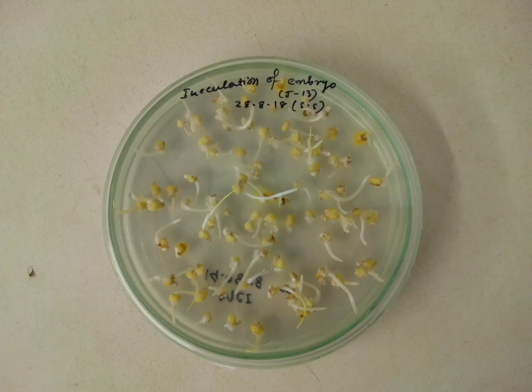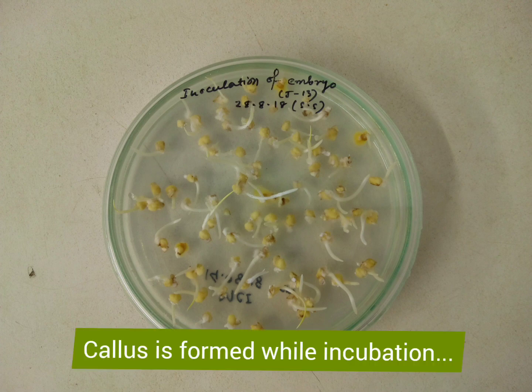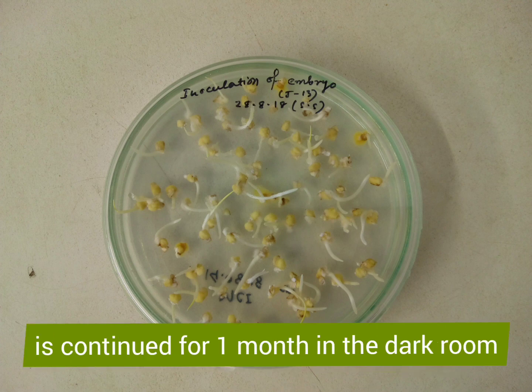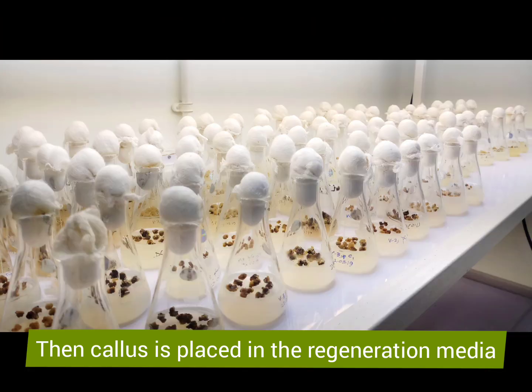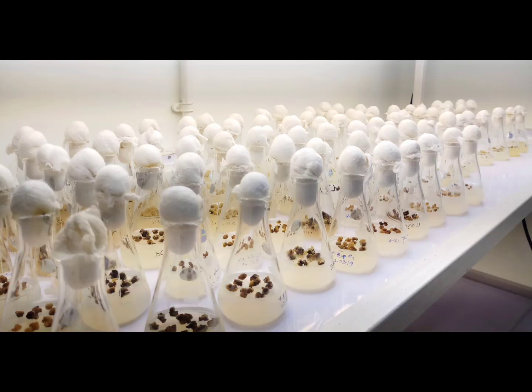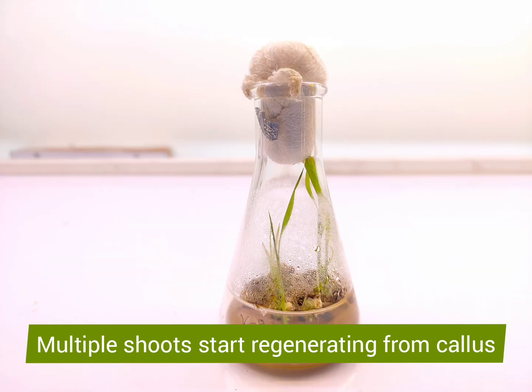This is achieved when the excised embryos are incubated in a callus induction medium for 10 days in the dark room. Callus is formed when incubation is continued for one month in the dark room. Callus is now placed in the regeneration medium and maintained in the light room, where multiple shoots start regenerating from the callus.